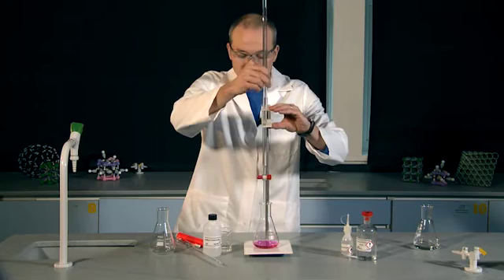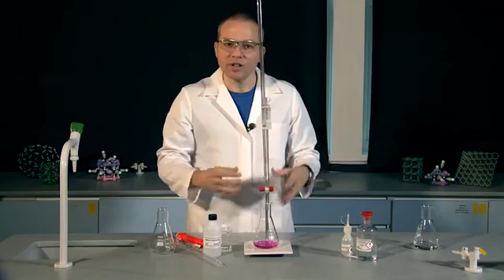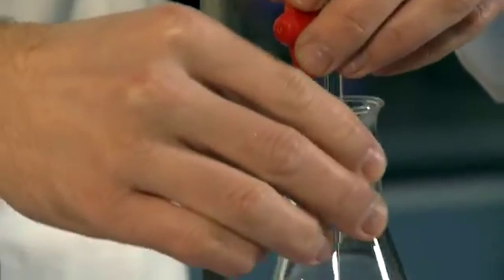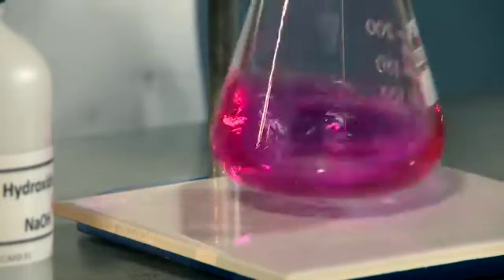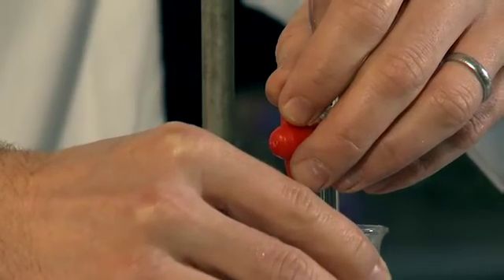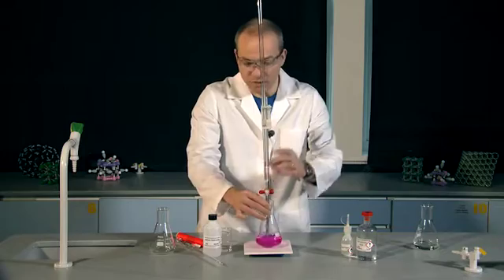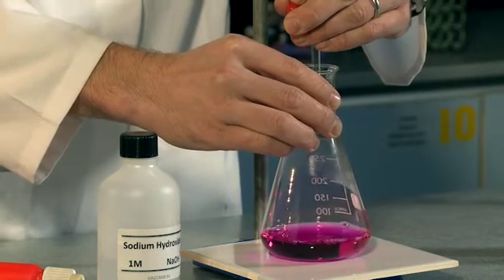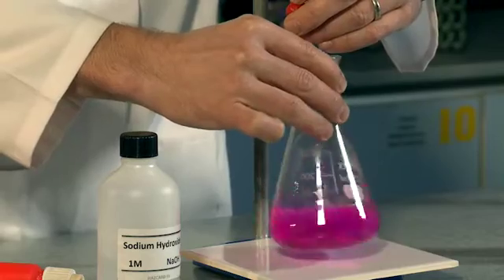This time, I'm going to add until probably about 25 centimetres cubed and then approach the volume that I know is the end of the titration a little bit more carefully. I'm going to add a little bit more carefully. It's still pink, and now I can add one drop at a time and swirl thoroughly, and just keep a very close eye on the colour of my indicator.